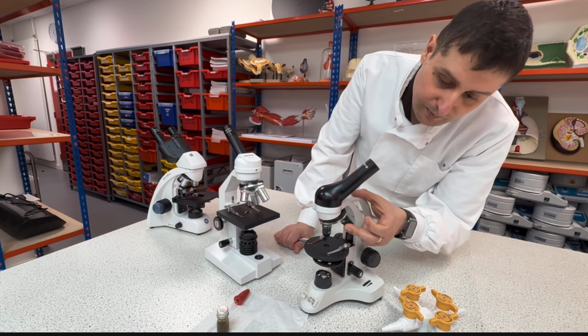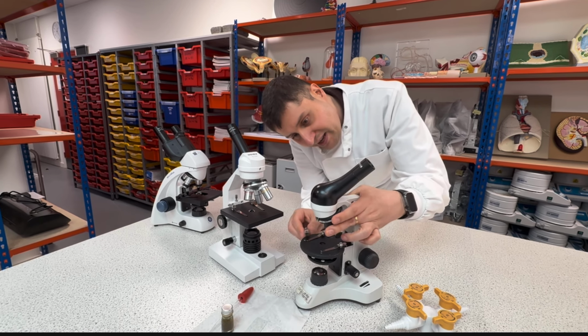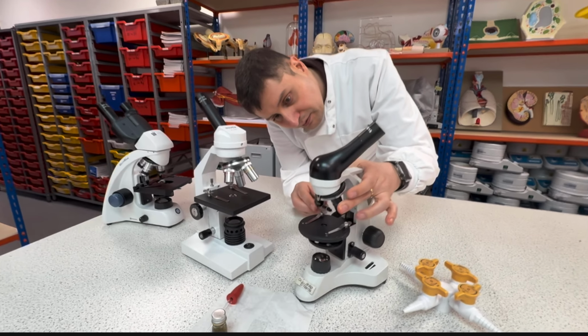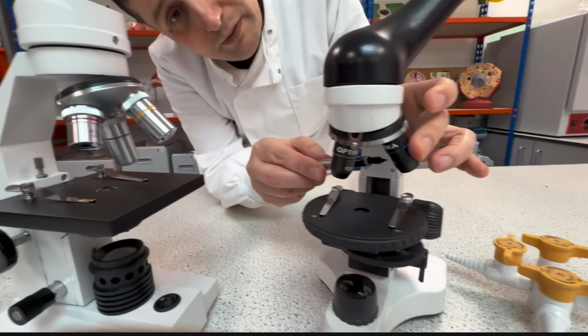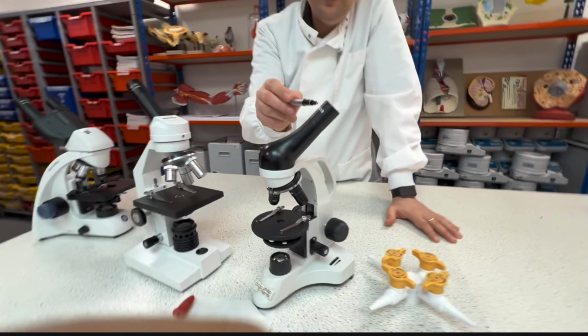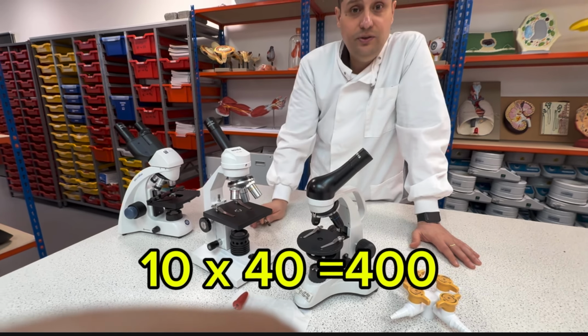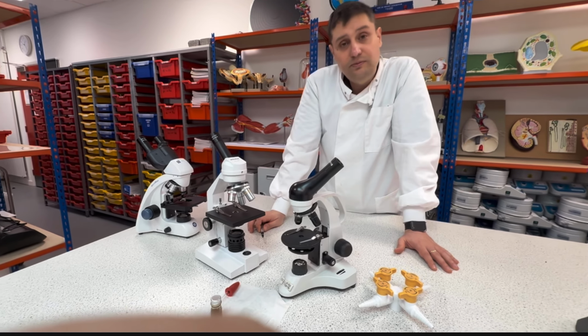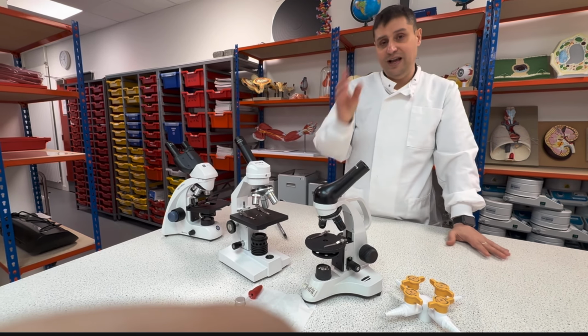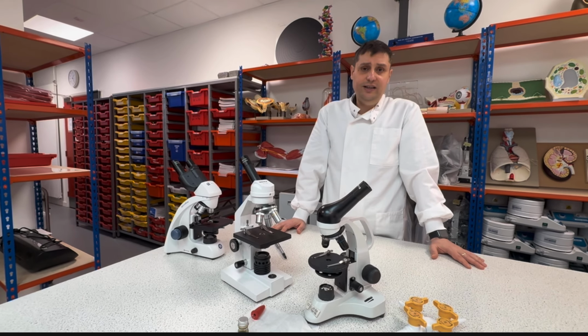So here the blue stands for 40. So this is 10 times 40, 400. Same thing. So that's the logic behind the lenses.